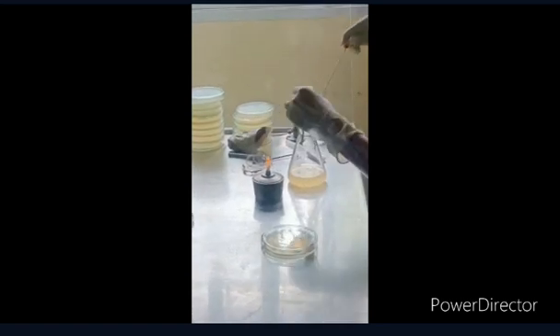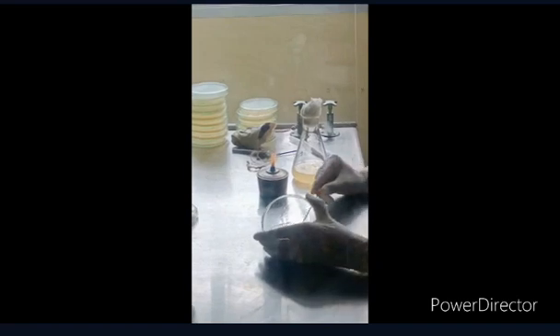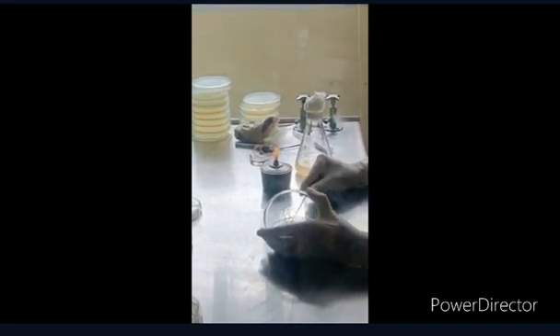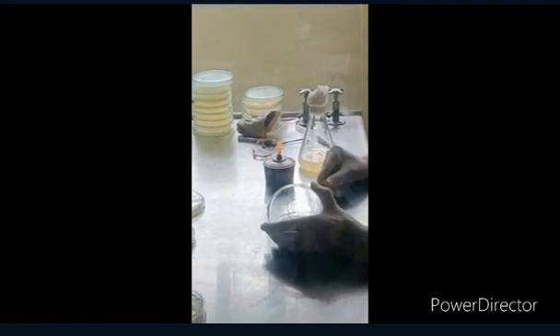Take the cotton swab into the bacterial suspension and close the bacterial suspension after flame sterilizing its cover. After that, you need to spread the bacterial suspension on the agar plate with the help of the cotton swab.